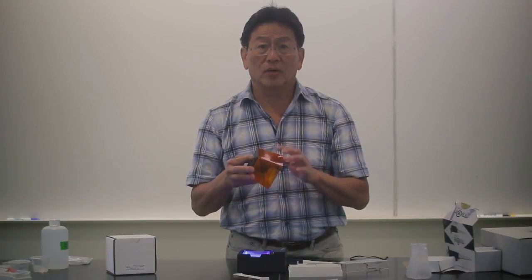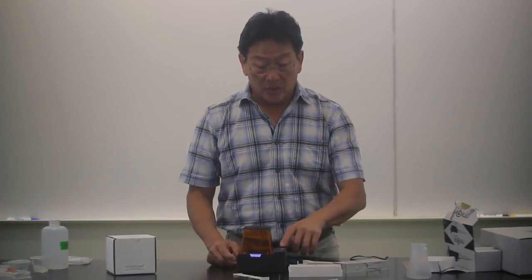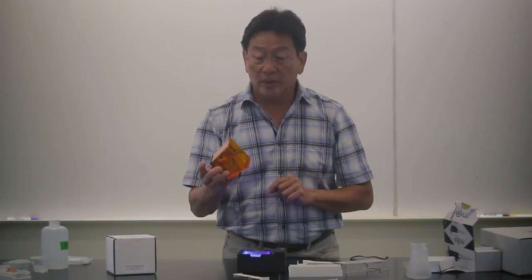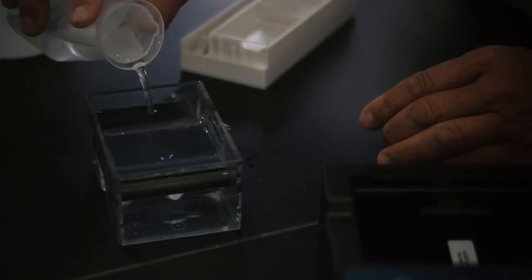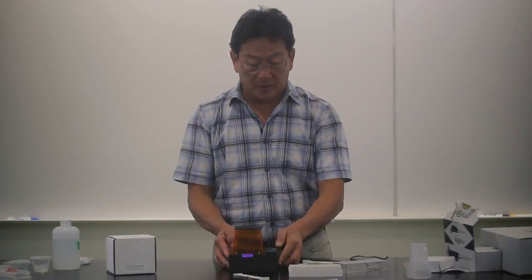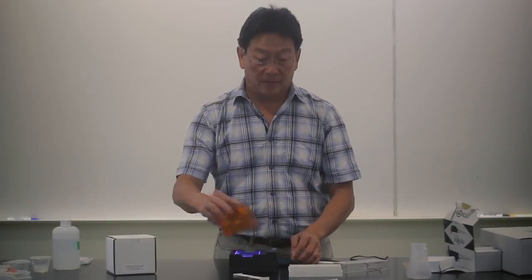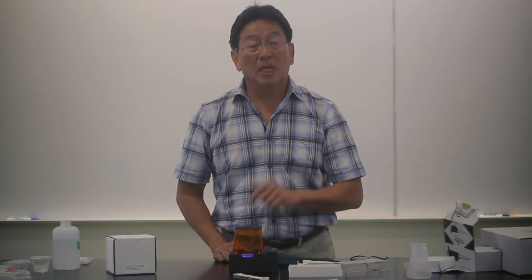When you're ready to run after loading the gels, you take the photo hood — this is actually a visualization hood. This plastic is made specifically for you to see the fluorescence from the DNA when it's bound to the gel green. This goes over the unit and then you can turn it on. A nice safety feature is that this unit contains magnets on the hood because there is a safety switch on the side, so without the magnet on there, you cannot get the gel running. I'll demonstrate: you fill this with some buffer, turn the light on so the light turns on. When the lid is tilted or taken off, you'll see the green light turns off. When you put it back on, the green light comes back on. That is a safety feature so that students will not have the opportunity to put their fingers in there and get a tingling feeling that they may enjoy.